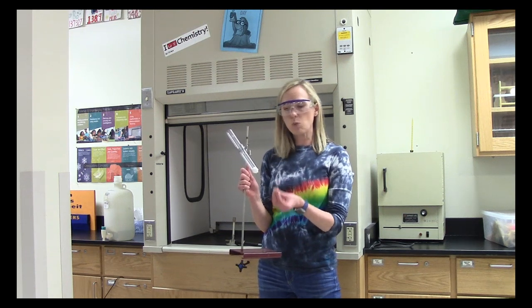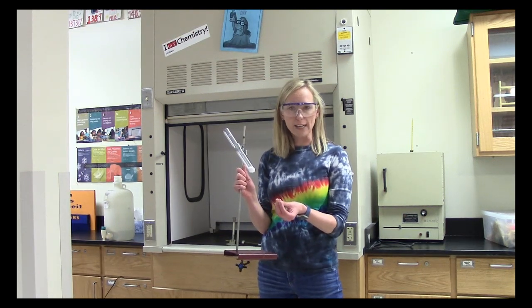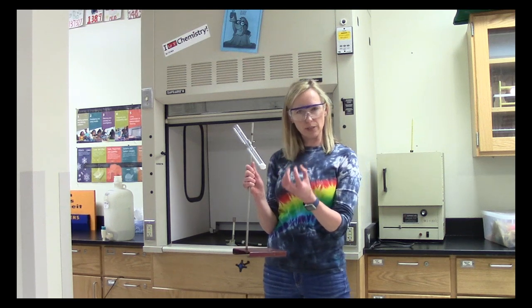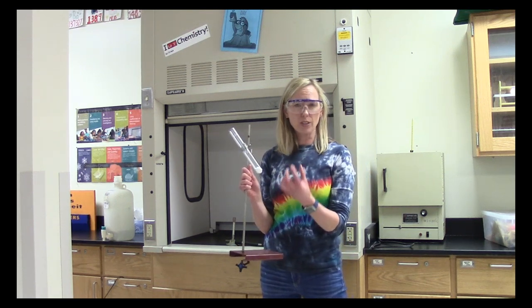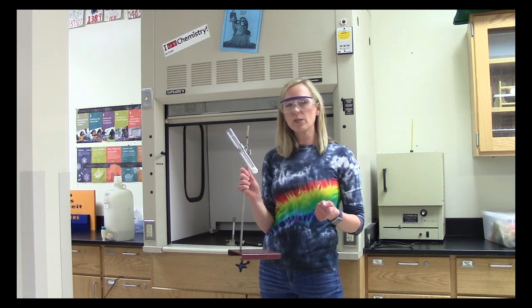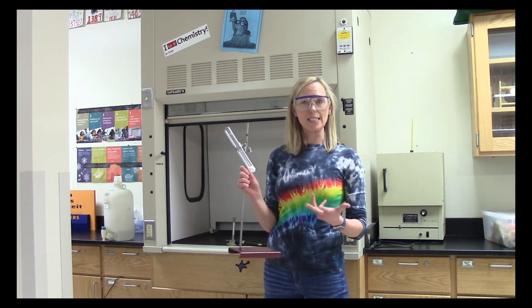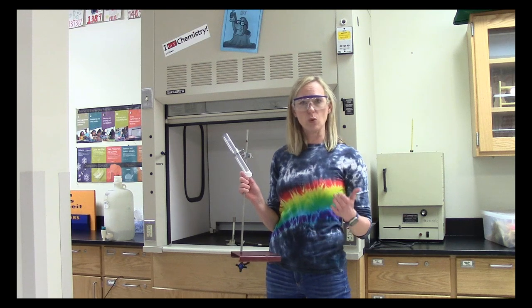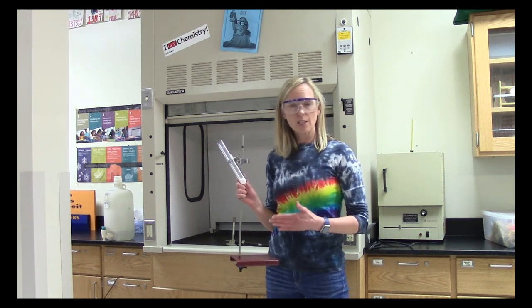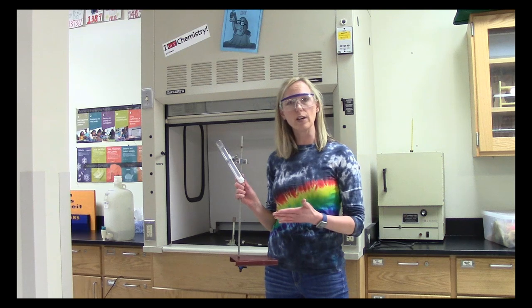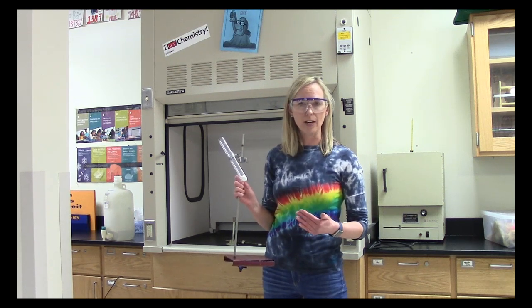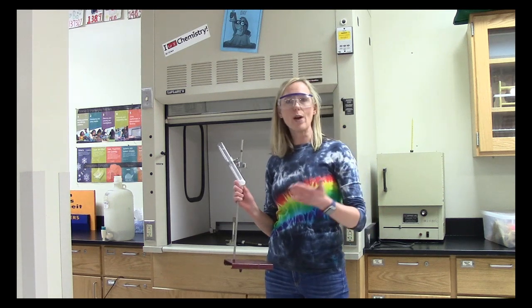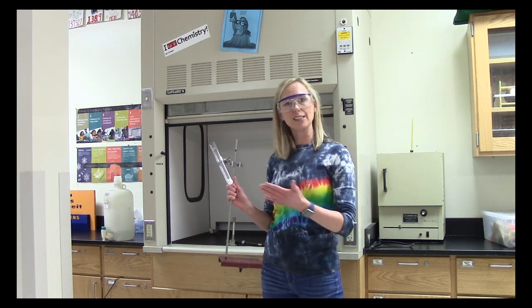What I'm going to do is I'm going to gently heat up and warm the potassium chlorate and you're going to see it become more molten. It's going to look liquidy and what we're trying to do is make the potassium chlorate decompose. And as it decomposes, it's going to turn into something much more stable, which is potassium chloride, which is an ionic compound. You'll realize that what we lost as the potassium chlorate went from KClO3 to KCl is the oxygen. Where did the oxygen go?